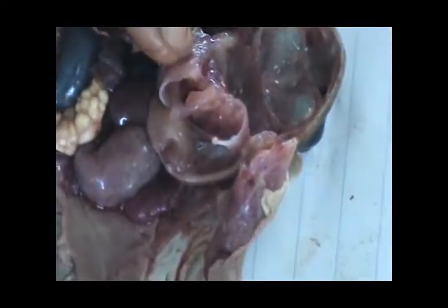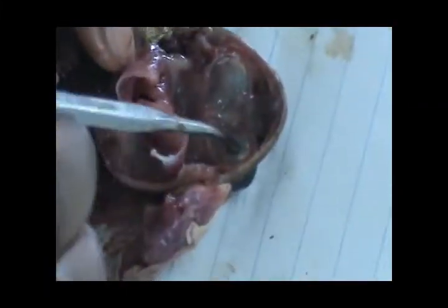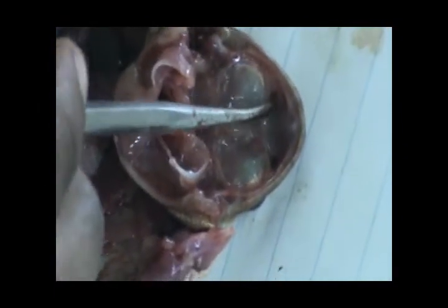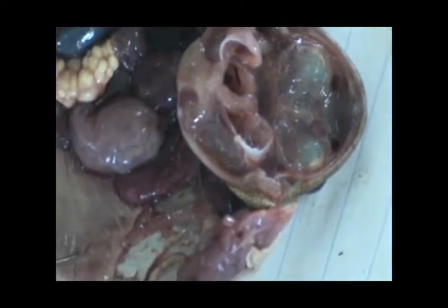These two holes are openings to the Eustachian tube. Then you see these two big dark areas — those are the eye orbitals, like eye sockets. And then these two holes immediately after are openings to the nostrils.